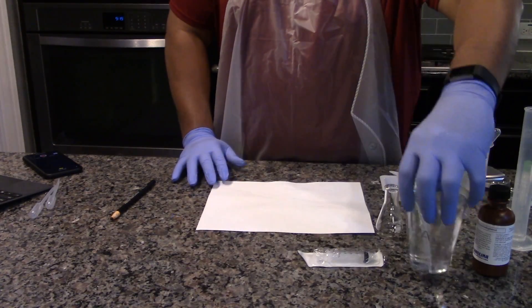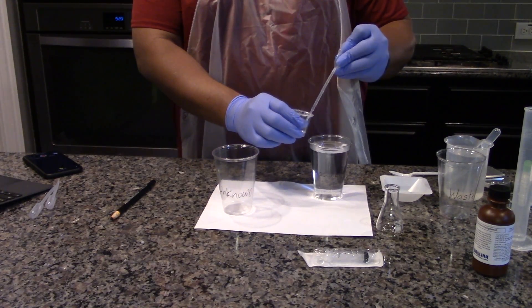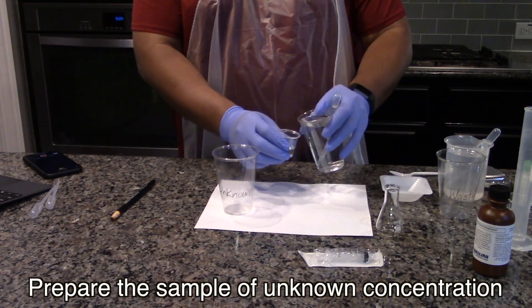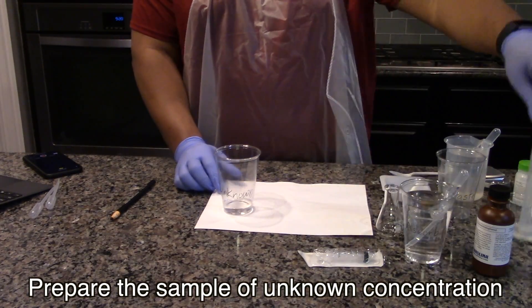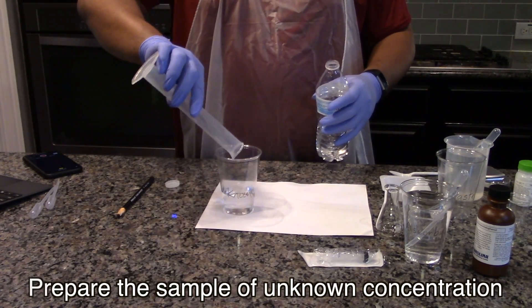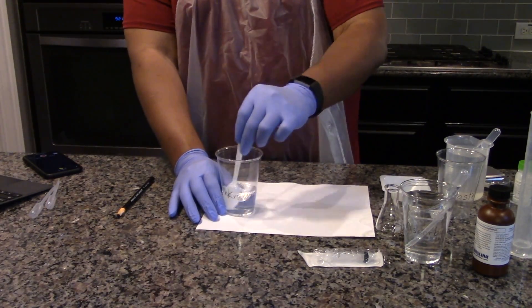Prepare the sample of unknown concentration. Fill the medicine cup between 50 and 100 percent full with the ascorbic acid solution. Transfer the ascorbic acid from the medicine cup to the 10-ounce cup labeled unknown. Add an additional 50 milliliters of pure water.